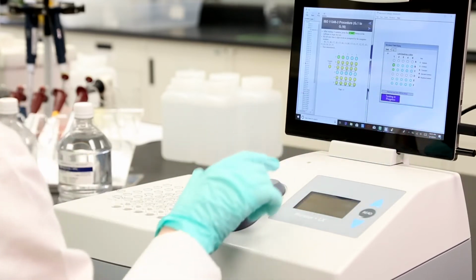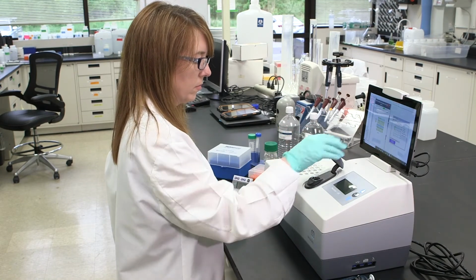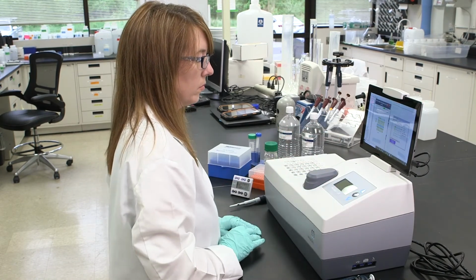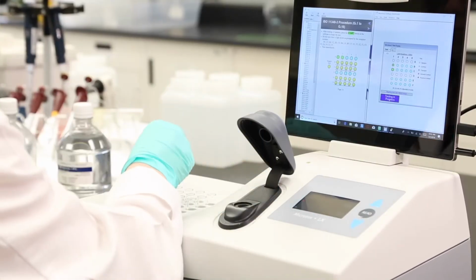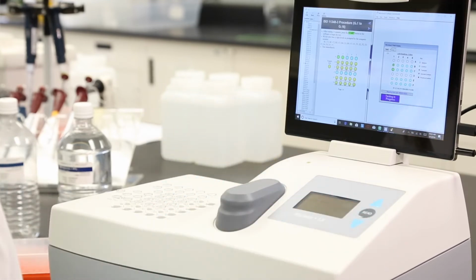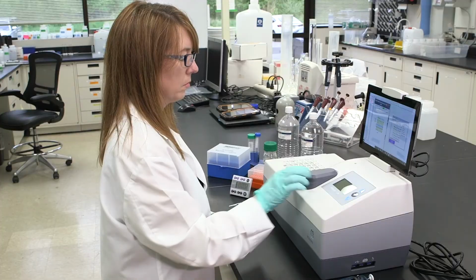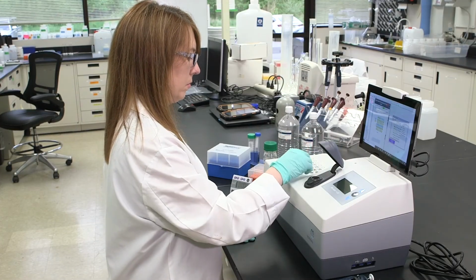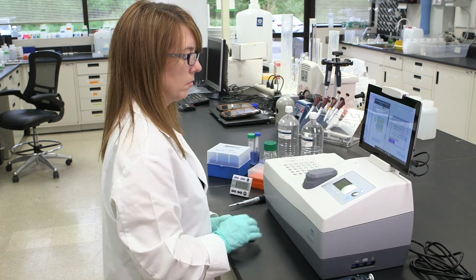Follow on-screen instructions, placing the highlighted vial into the read well and pressing the Read button on the instrument to record it. Read cuvettes B1, C1, B2, C2, B3, C3, B4, C4, B5, C5, E1, F1, E2, F2, E3, F3, E4, F4, E5, and F5.